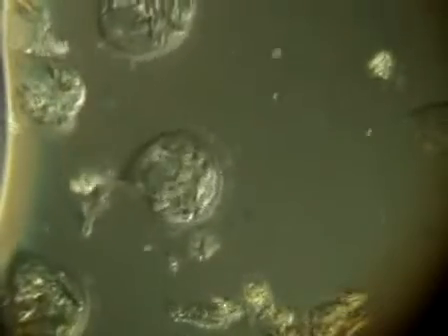I've set this right now to look at the sample using DIC. What that does is give you surface textures of cells and internal structures of cells, if they're large and if they have those structures, much more cleanly.